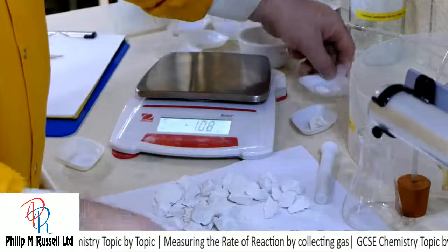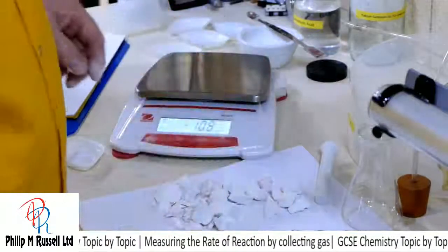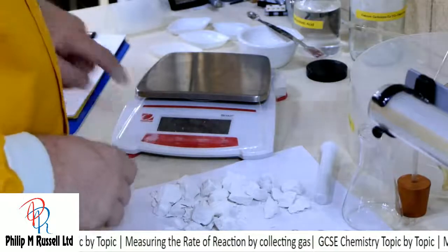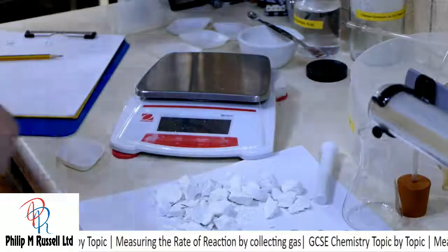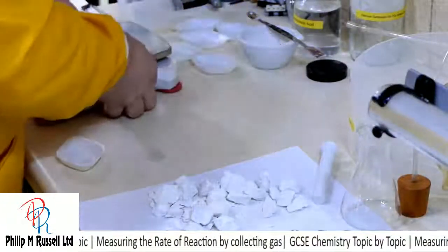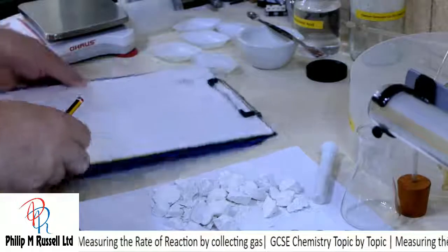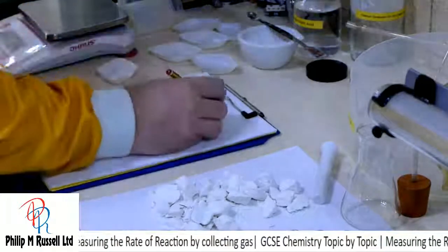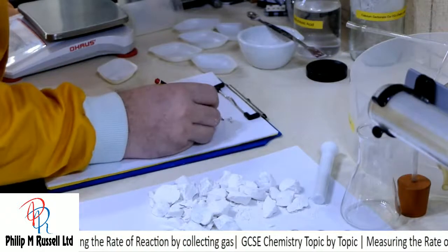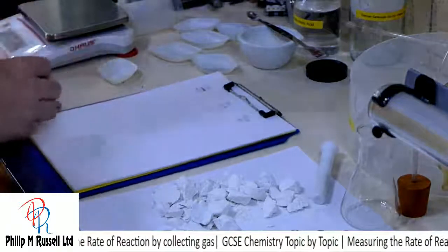So we've got our 3 samples and we're going to try these out and we're going to see how well they work. Now I don't know how much gas that I'm actually going to produce on this. So we may find that we're not going to get this working too well, but we'll see.